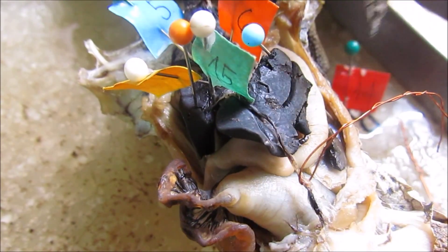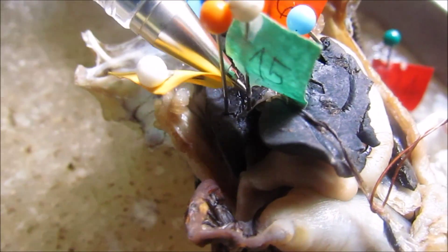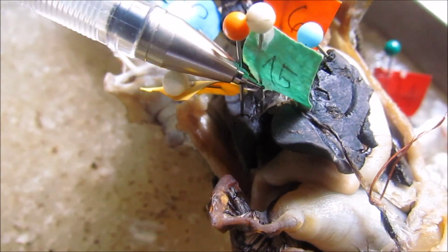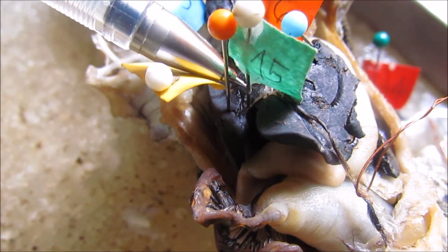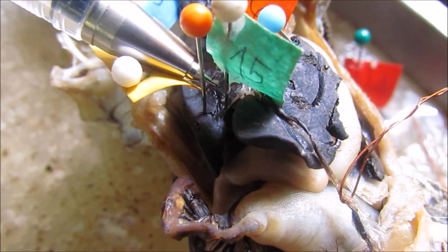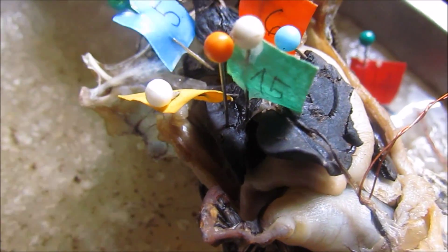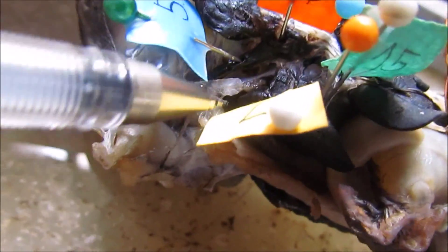This is the ventral abdominal vein — so instead of postcaval, the hepatic portal vein branches out from it. Look at number 15 — this is the ventral abdominal vein. The hepatic portal vein branches out from the ventral abdominal vein. From the postcaval, what branches out is the hepatic vein.